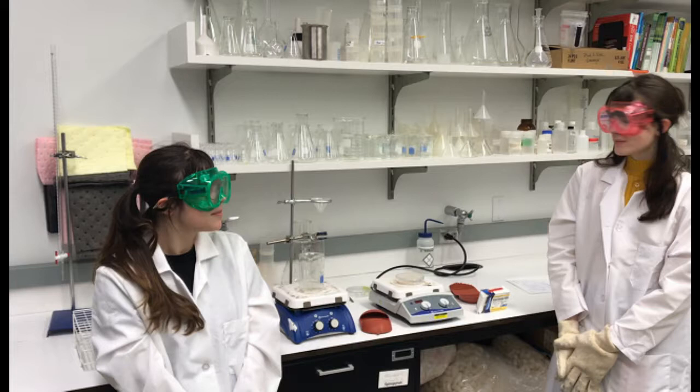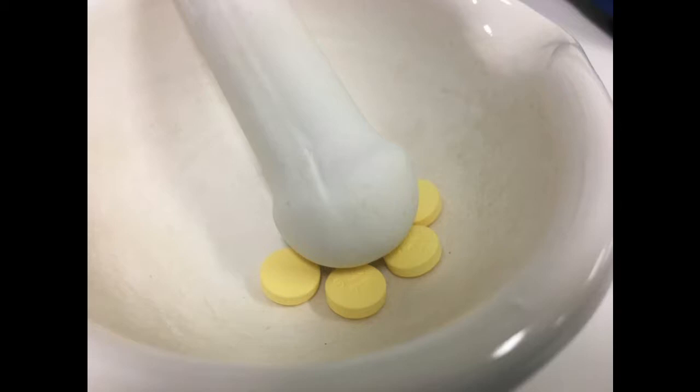Hi, this is Nathan George and I'm also from Innovation Academy Charter School located in Tingsboro, Massachusetts. I will be detailing the process of extraction and crystallization of caffeine.